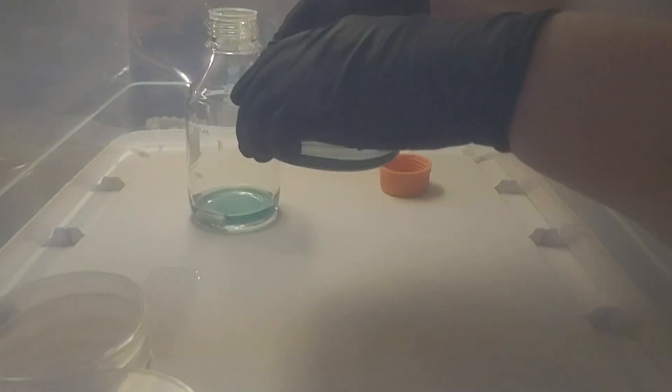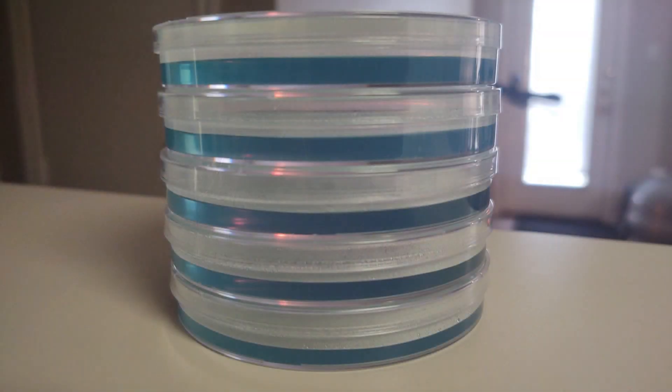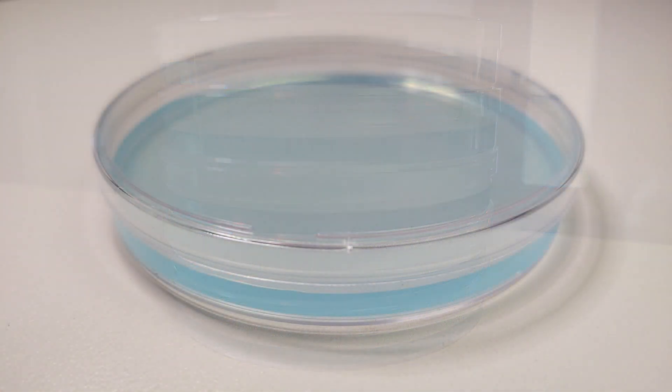Make sure the plate you're pouring into is flat, that it's sitting on an even surface. Do not overfill and try not to shake the agar until it's completely cooled. You do not want it to splash up around the sides or onto the lid.